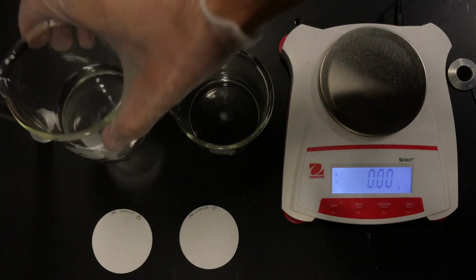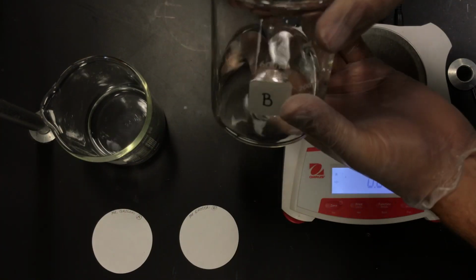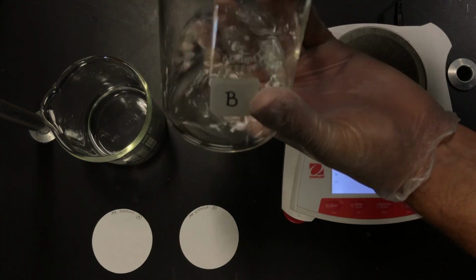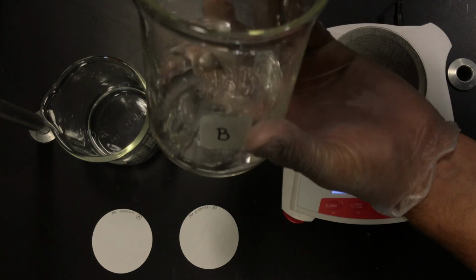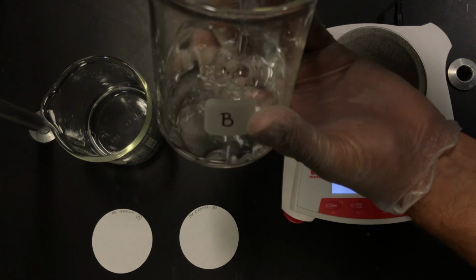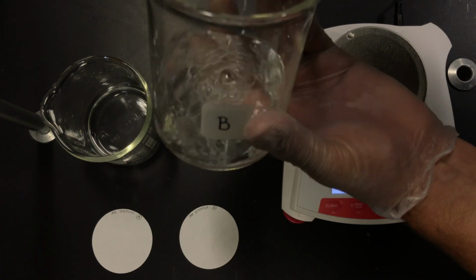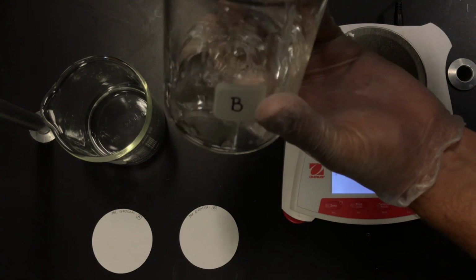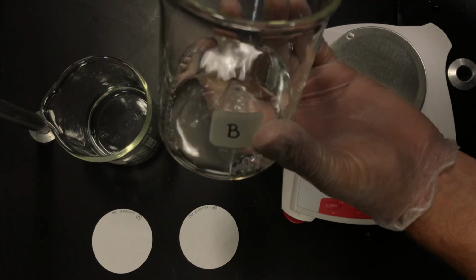Okay, and then we're going to do the same for B, and it's almost dissolved, and we're going to use a different stirring rod here. And it's all dissolved as we would suspect. Group 1 ions are always soluble. They have a low charge, so therefore they coulombically attract the carbonate weakly, so therefore water can compete for those charges and dissolve them.